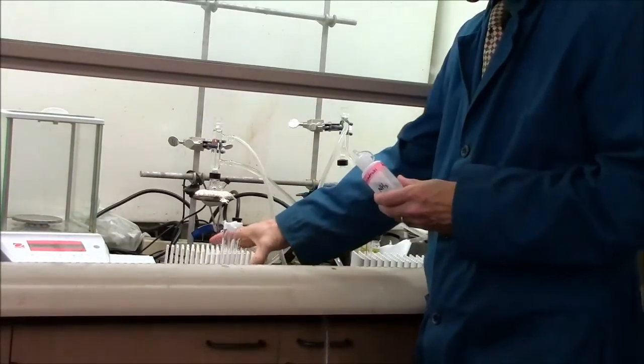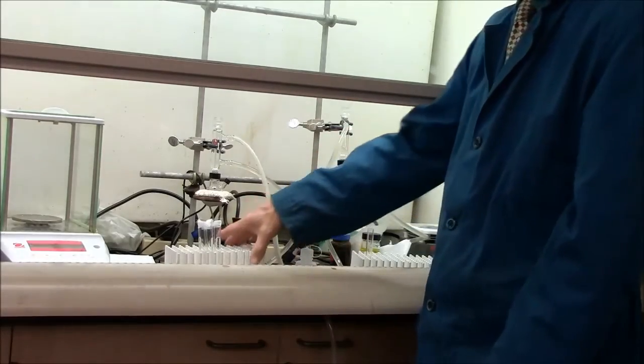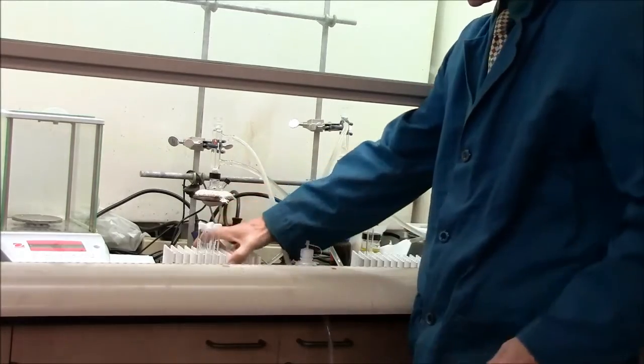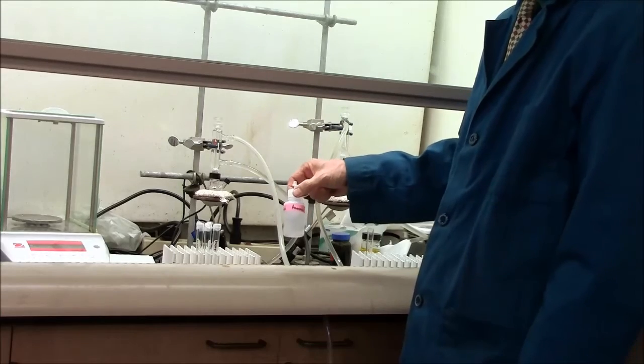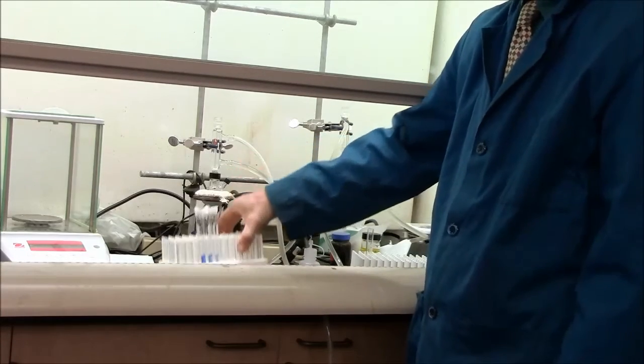So I will keep the concentrated ammonia in the fume hood here, and the color standards in the fume hood. So when you're ready to test, I recommend you use the ammonia in the fume hood because it's smelly, and compare your color to these color standards here.